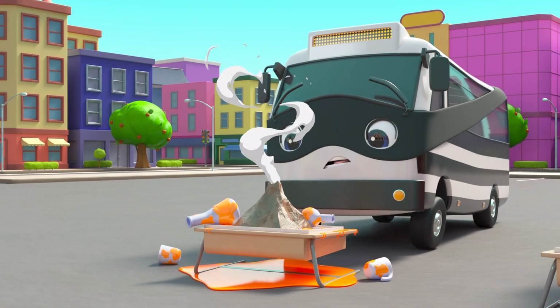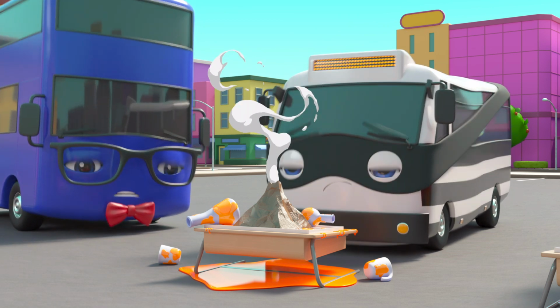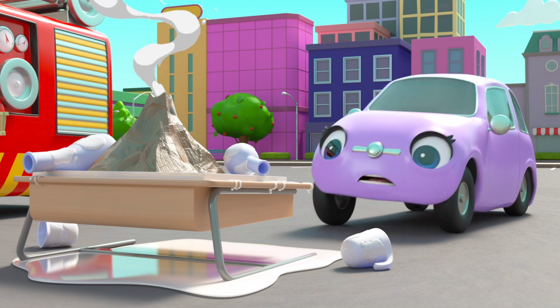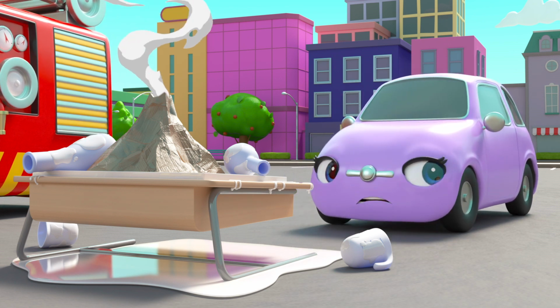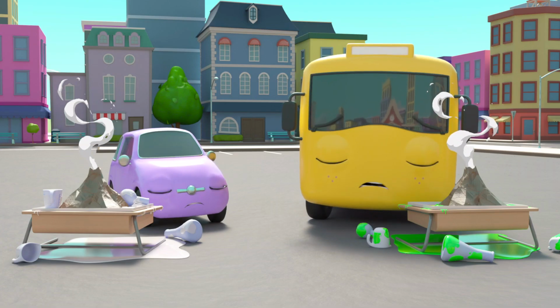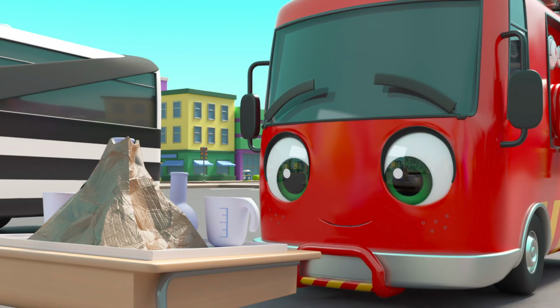What a mess! It looks like Bandit didn't do it right! Oh no! Scouts didn't go right either! Maybe Buster? Buster has made just as much mess as the others! Why isn't it working? Can Ash get it right?